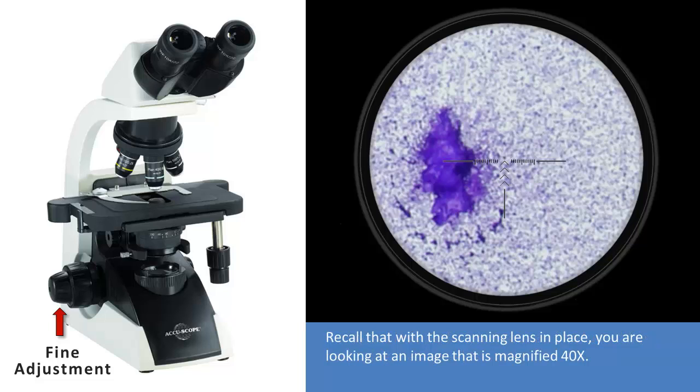Recall that with the scanning lens in place, you are looking at an image that is magnified 40 times. Large dark areas of stain are sometimes the easiest areas to focus on at these low levels of magnification. We're now ready to try the 10x objective lens.